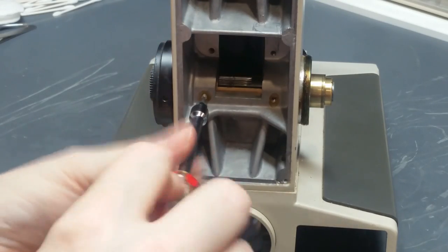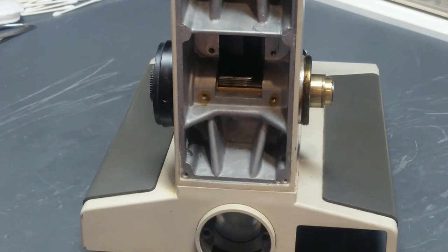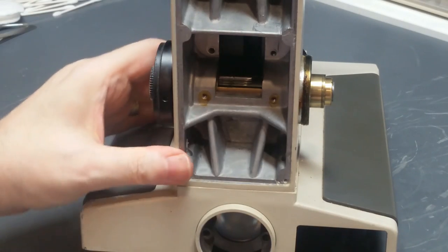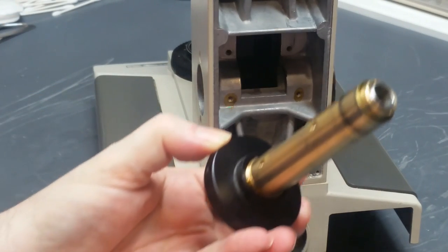I've experimented with a lot of ways to get these out, including heating tools to melt the glue that's in there, using a torch and a heat gun, and I found that the brute force mechanical way here is better than just about anything else that I've tried. Okay, so that guy is now loose. So in theory, if I grab this, the whole thing should come out. And it does.